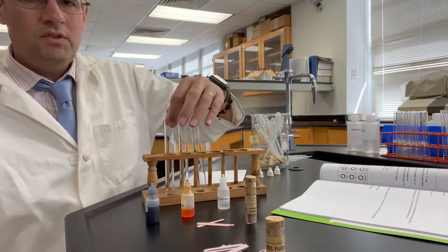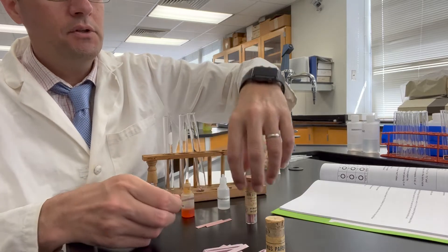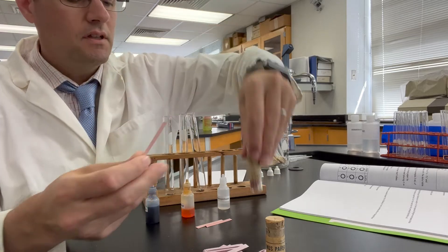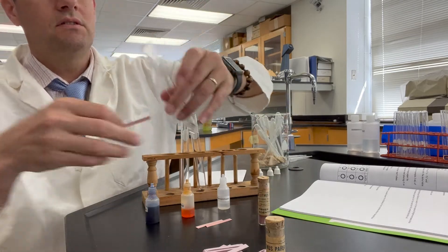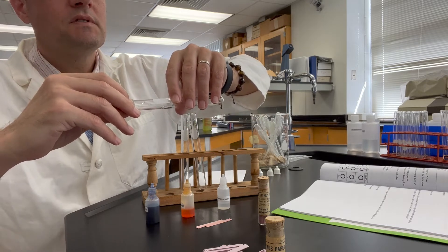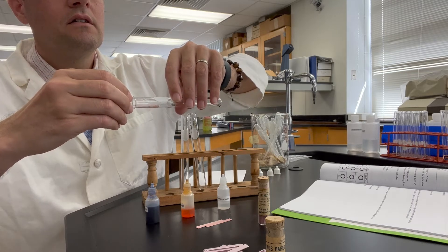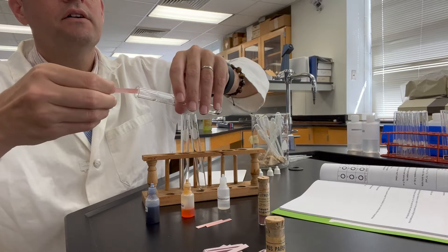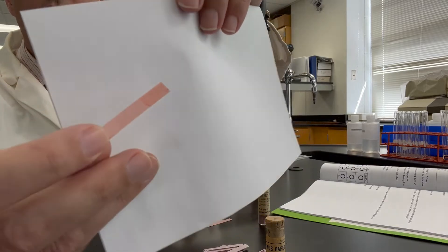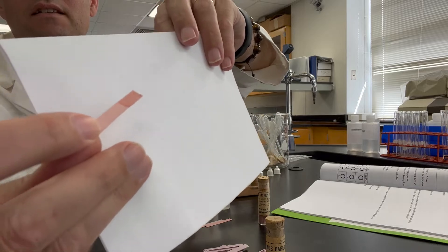Let's do the litmus tests of the 0.01 molar hydrochloric acid. We have two different kinds of litmus paper. Starting with the red litmus paper, we'll place the tip into the solution. This is the red litmus paper in 0.01 molar hydrochloric acid — hopefully you can see that in the lighting here.